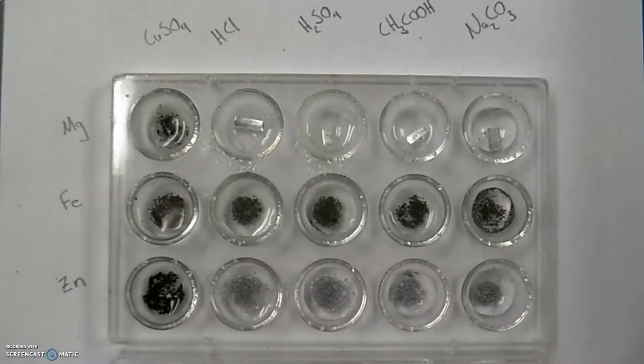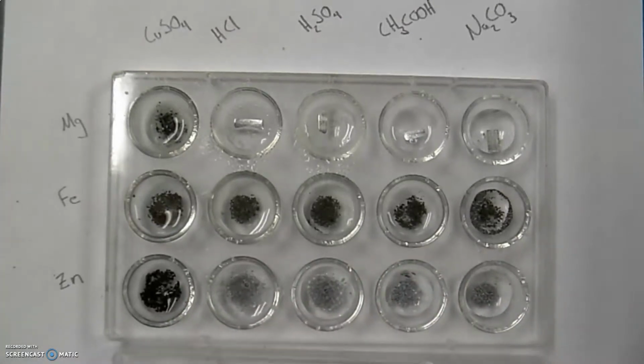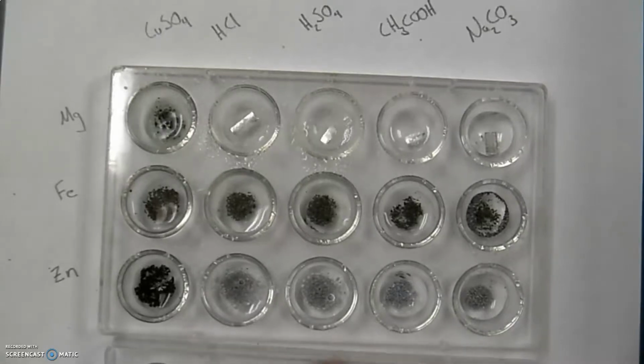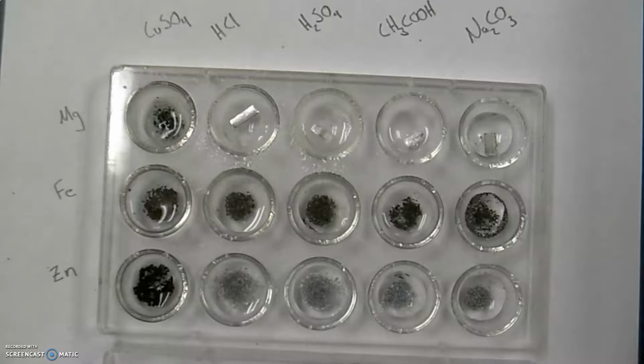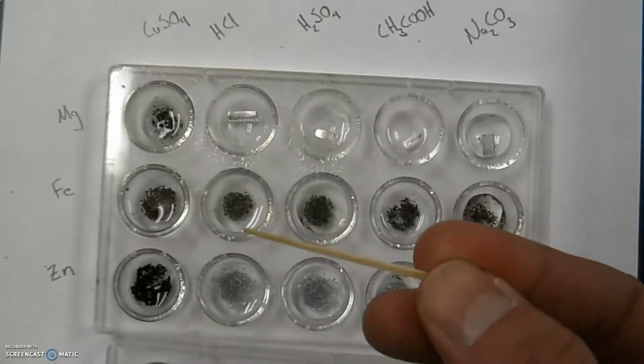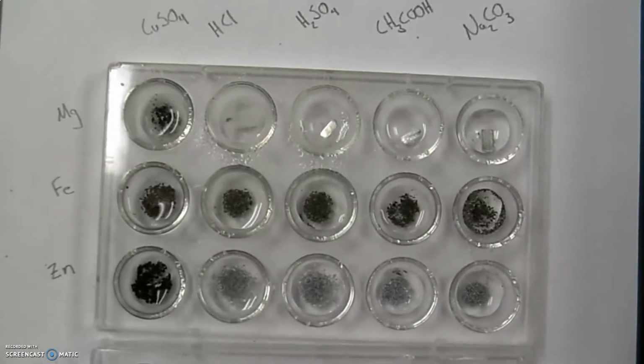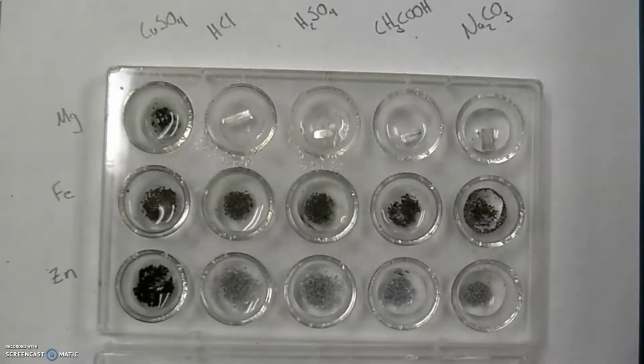And this one is a little bit harder to see. It's still whitish, still kind of bluish, but there's something going on here. And I realize I'm cross-contaminating because I keep using the same toothpick going across here, but generally that's okay. I will change that out.